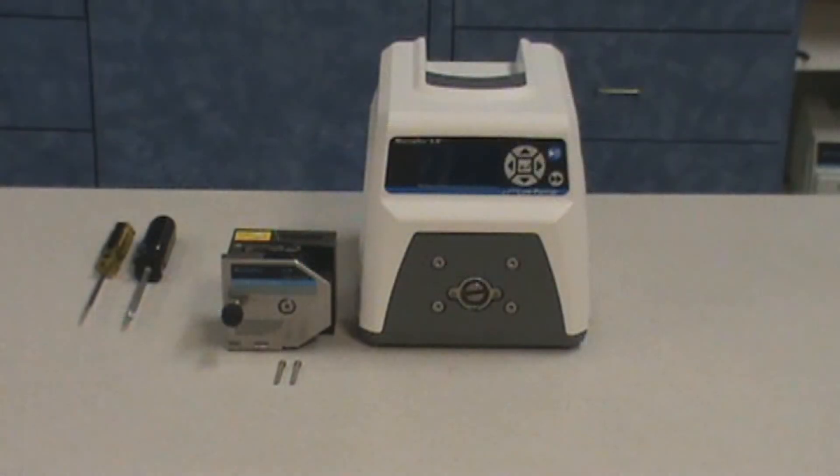What you will need is an LS high-performance pump head, mounting hardware that is included with the pump head, and a compatible drive.